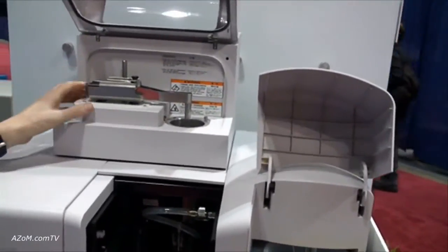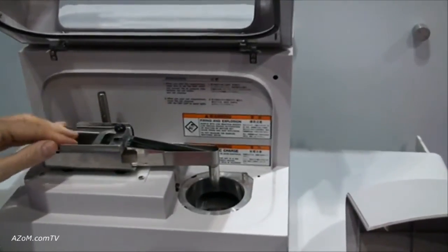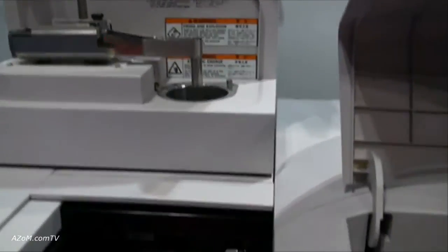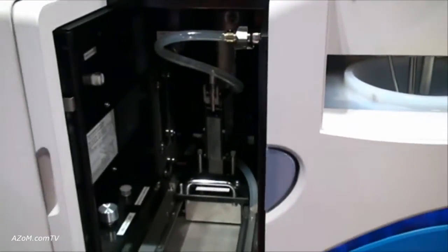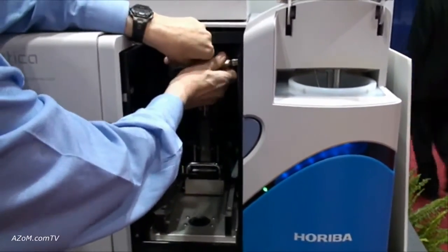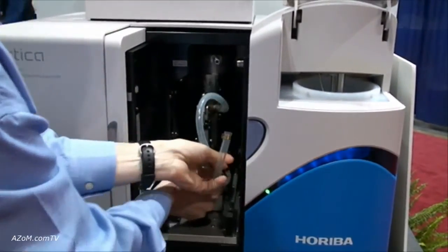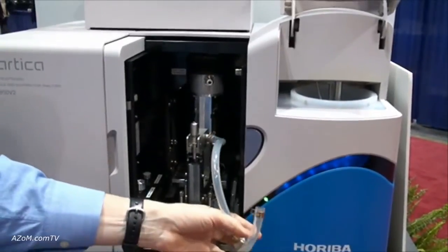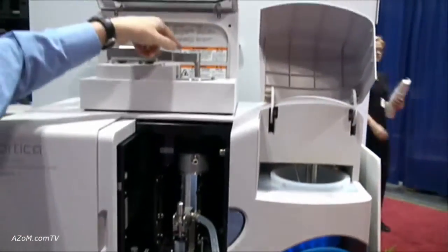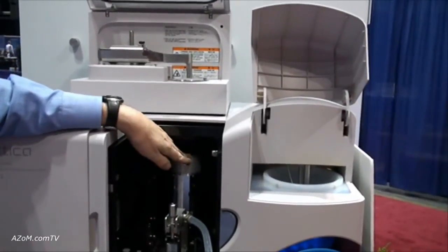The dry powder feeder accessory, which you see on top here, includes a vibrating tray. We load the powder onto the tray, it vibrates down into a different cell. What I'm going to show you now is how quickly it can be changed over from measuring wet suspensions to dry powders. I'll detach the liquid connections, move this tray to the dry powder position, and we've now transformed the instrument into a dry powder system with a straight shot of powder from the vibrating tray down into the dry cell.